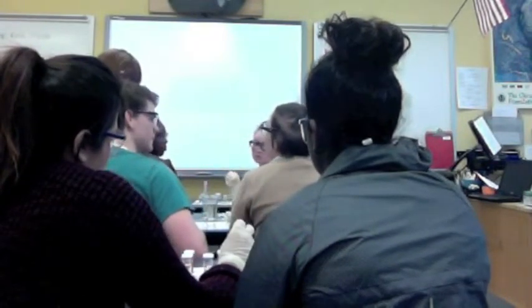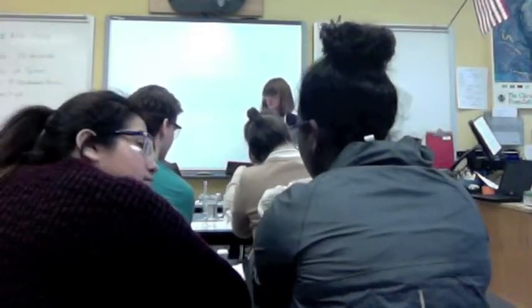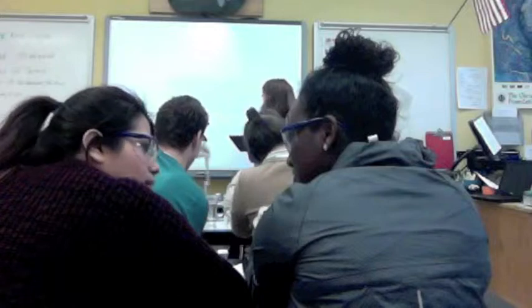Do we need any help here? We were just looking at what nitrates mean. Okay, perfect. Thank you all for using your resources. All right, so we're going to go ahead and test nitrates. Nitrate also takes 5 minutes to develop. So you're going to put that there, and I will let you know when it's time to look at nitrates. Nope, nothing yet. Thank you for your clarifying question. You're just going to leave it for now.